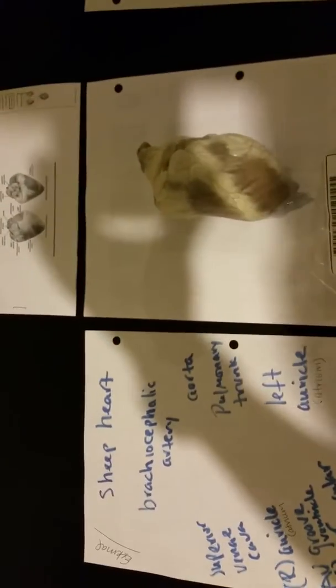This is John Pye recording the sheep's heart from the internal and the external view. At first, we will start with the external view. We will always use our main heart as our point, and we will use our scalpel to help us point to the main parts. Okay?